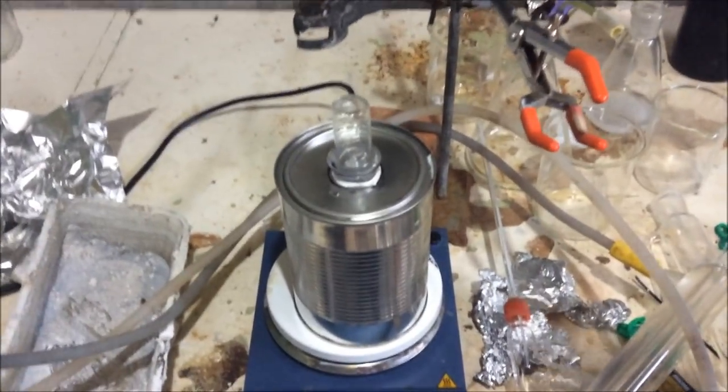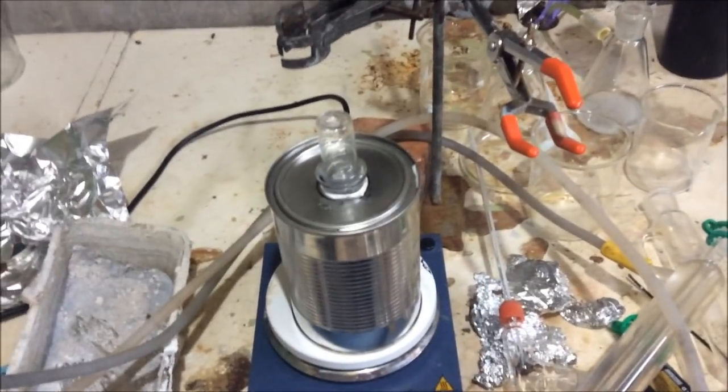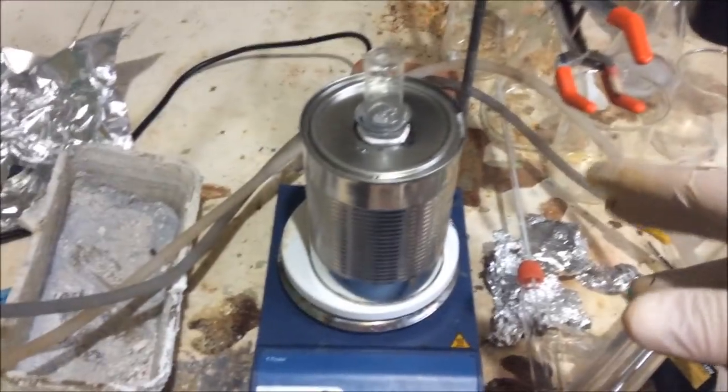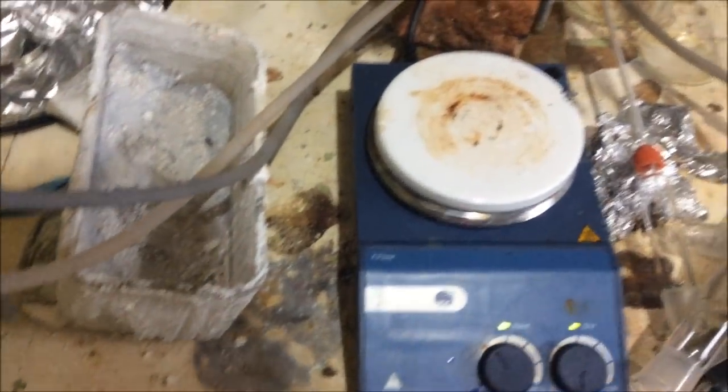Distillation was just about to start. There was some condensation in the head there. We're just about to get the stuff over, so I increased the heat a little bit. And the stuff wasn't coming over, so I thought that maybe it wasn't boiling properly in the flask or something like that. So I left it for quite a while, nothing was coming over. Turns out, my hot plate just decided to not heat anymore.